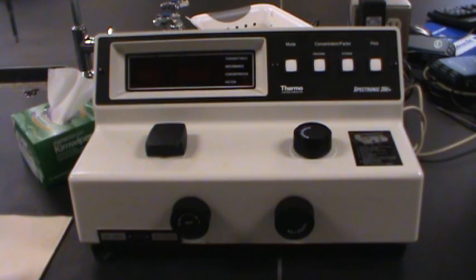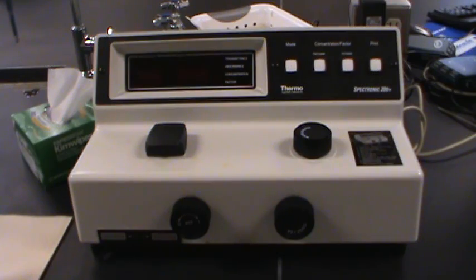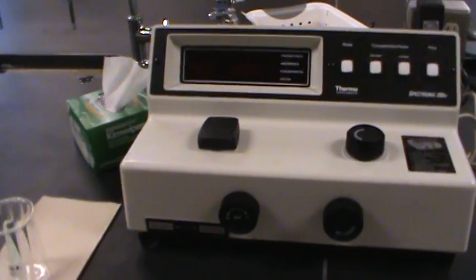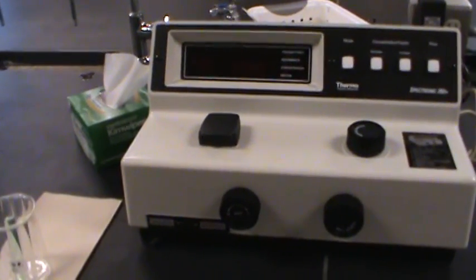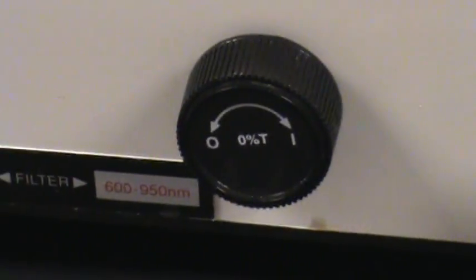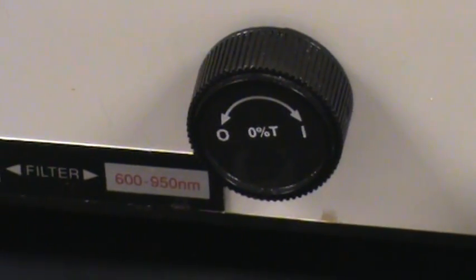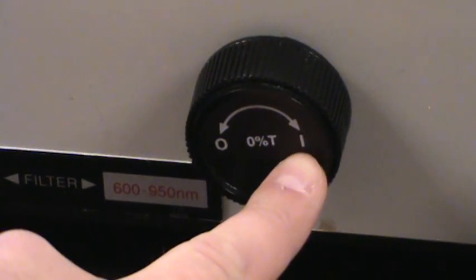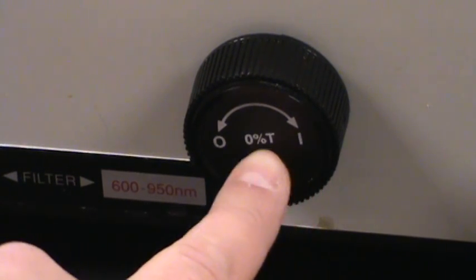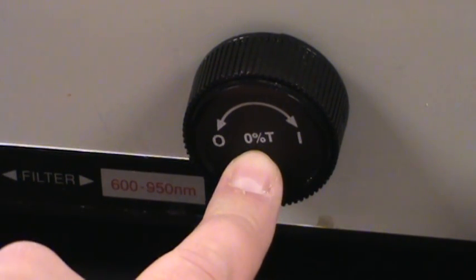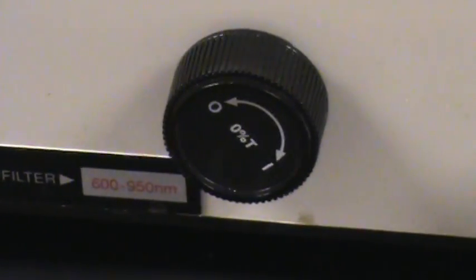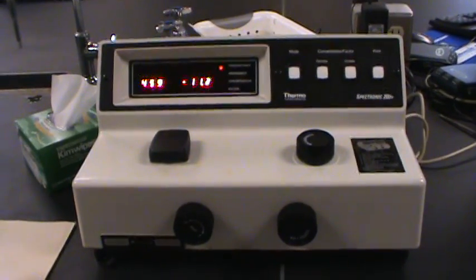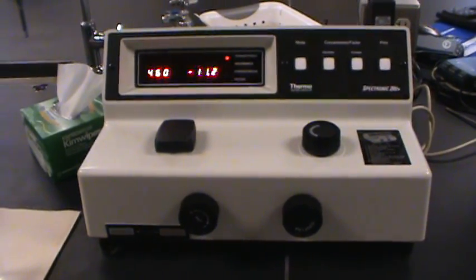The first thing I'm going to do is turn it on because it takes a little while for it to warm up. So right down here is the on switch. So you see that it's zero one, those are standard on off. This is also the zero percent transmittance switch. So let's click that to turn it on and you see the display has come on and is live.